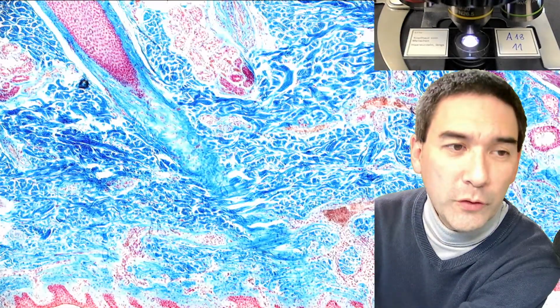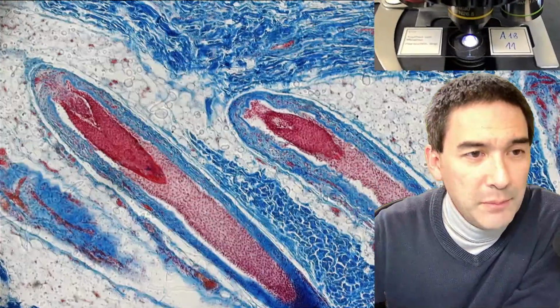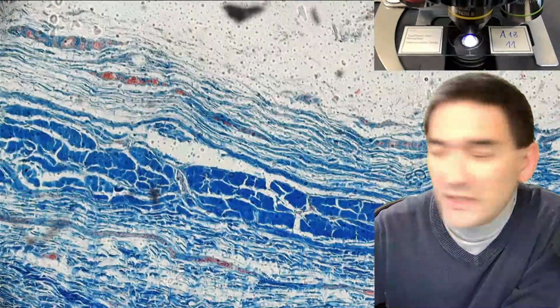I'm going to switch over to bright field. The colors that you see right now are because it has been stained, commercially stained, so that is the way it looks. I'm going to try to find a good sample here. These are all hair follicles, the red ones, but before I start explaining this, I want to find one that's a little bit better, because they look very incomplete.